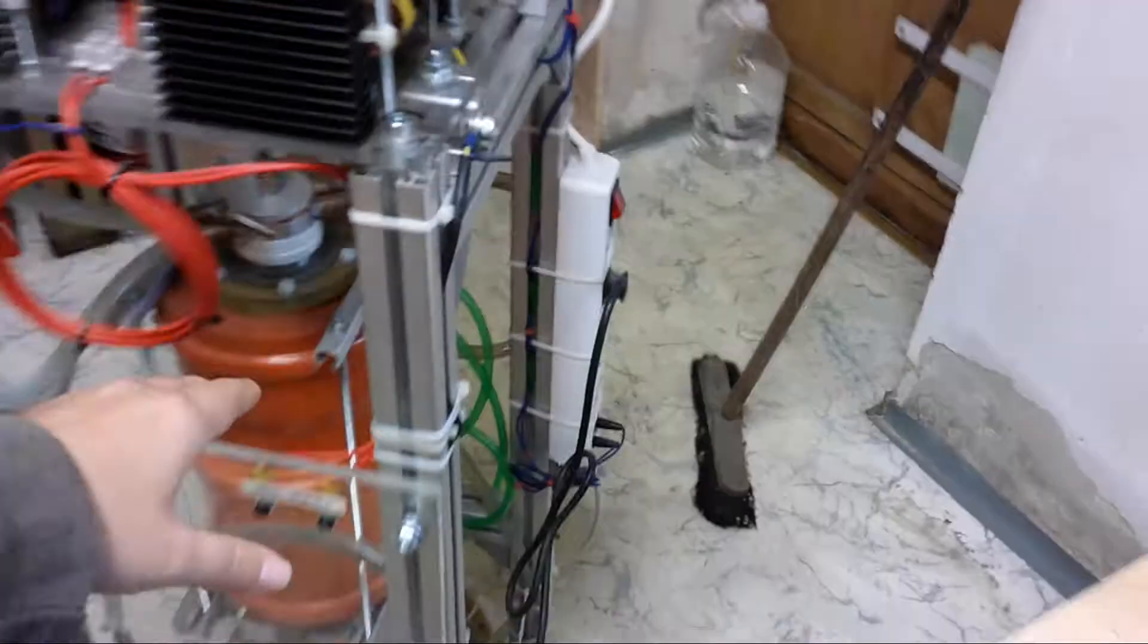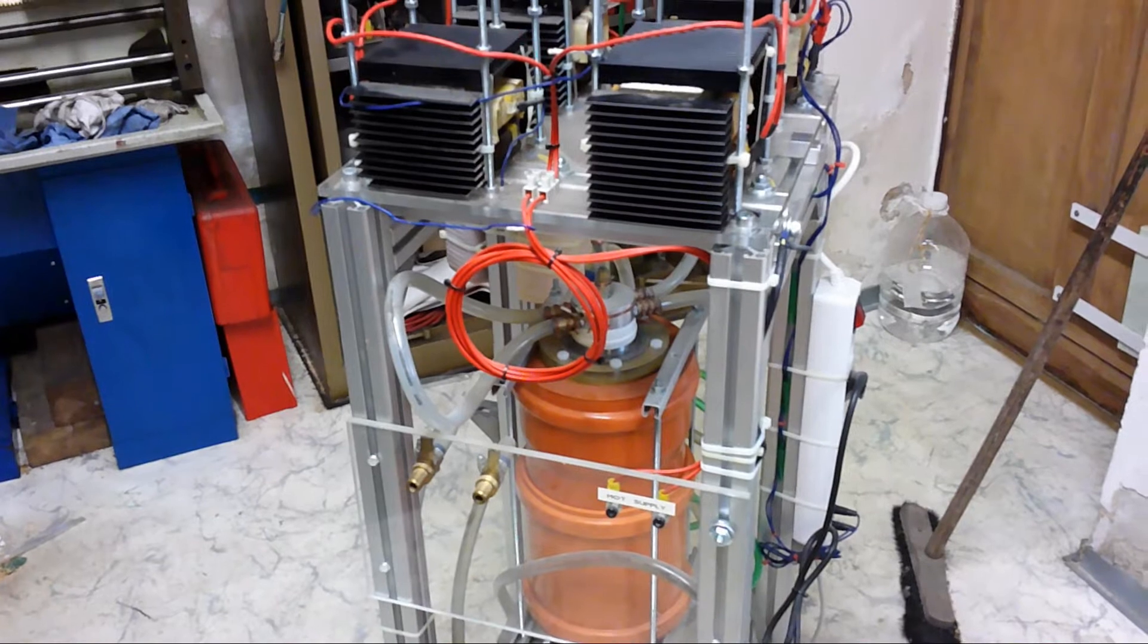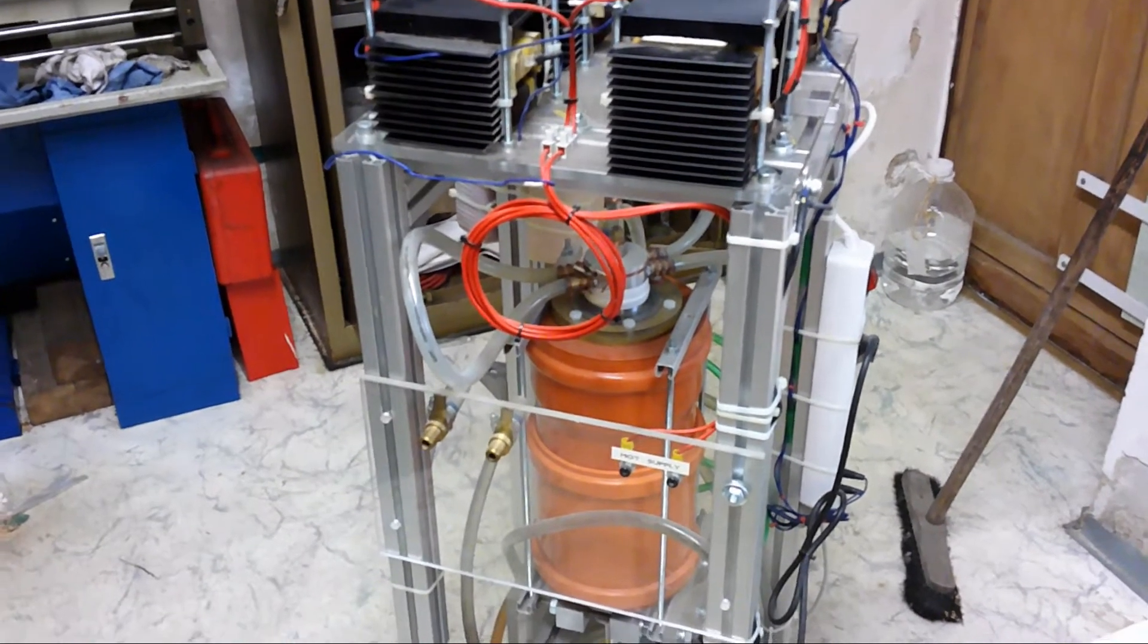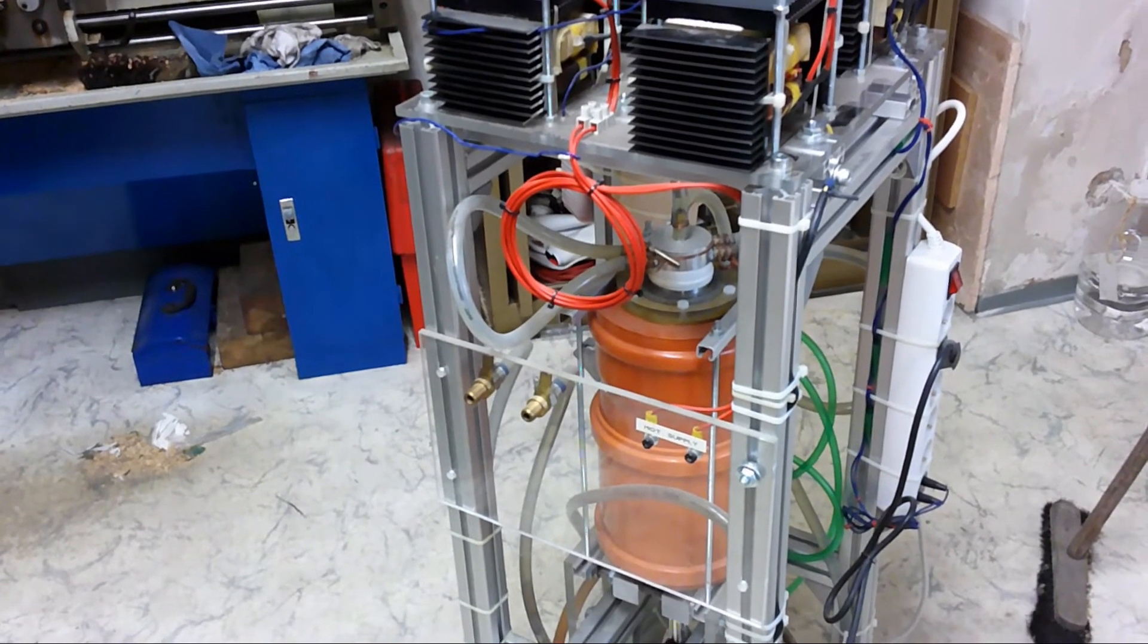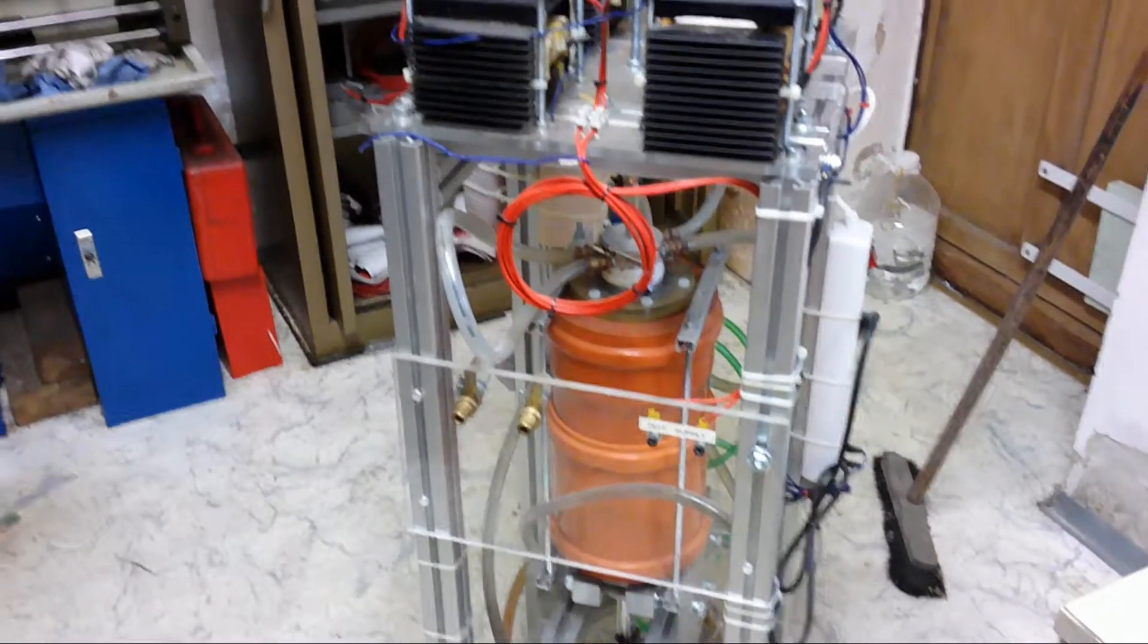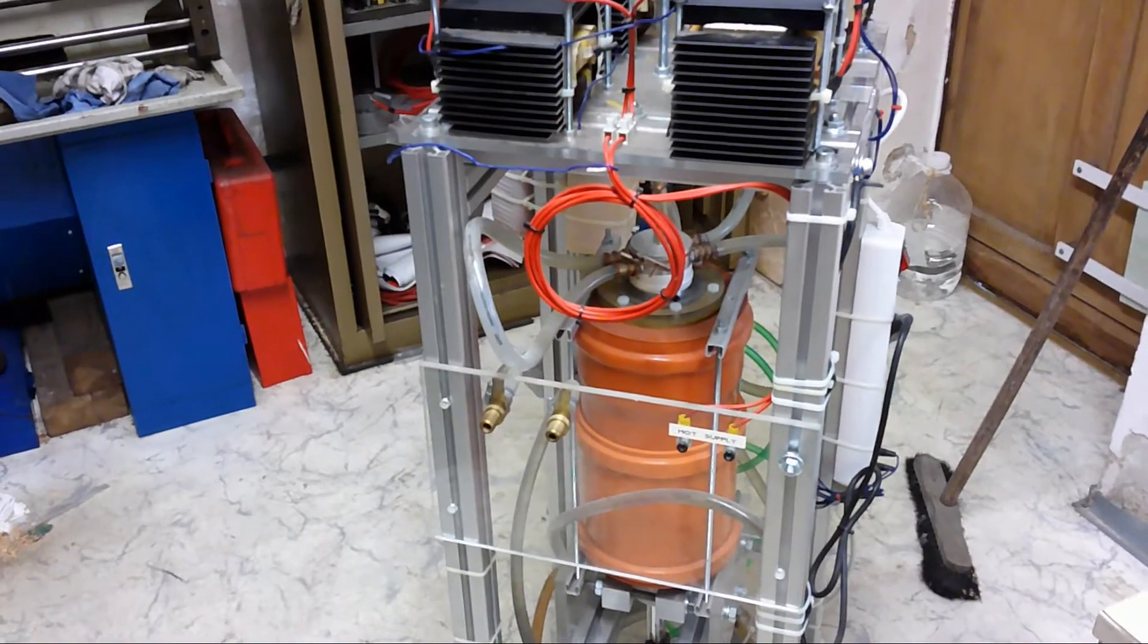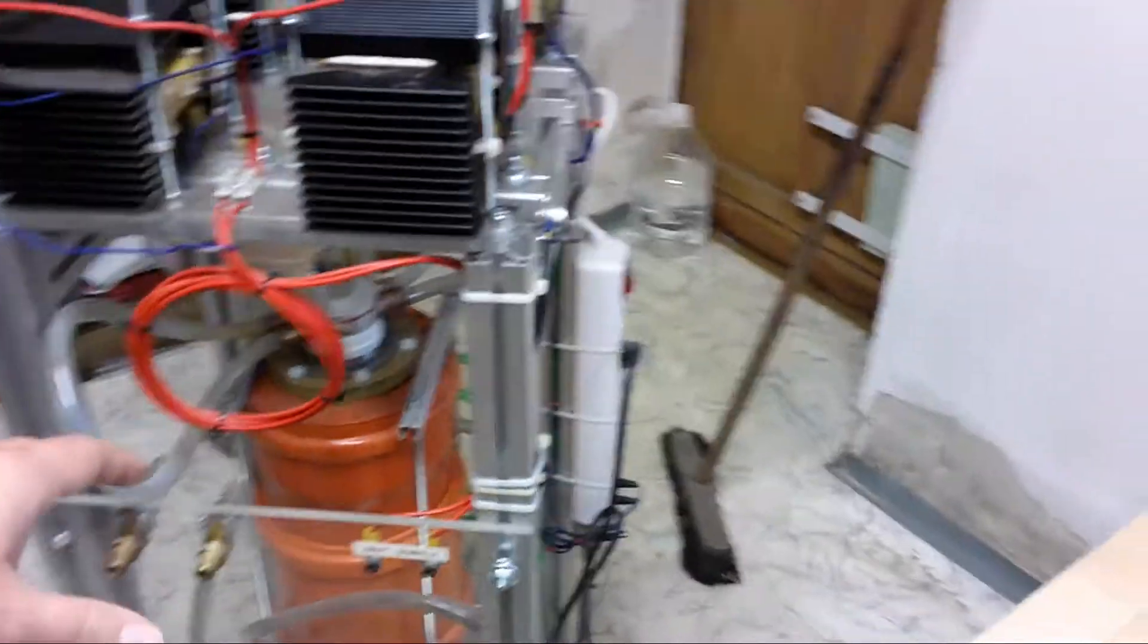Here, basically, that's the plasma chamber where the hot plasma burns. I have made some slight modifications to a common Birkeland-Eyde generator. I will tell you everything more in detail and show you the plans.